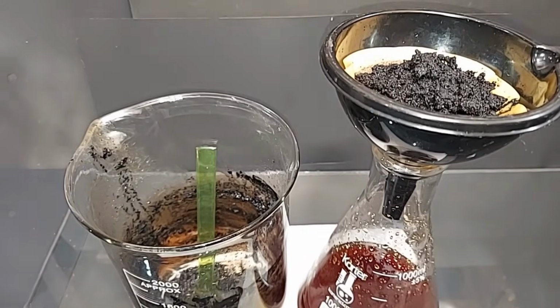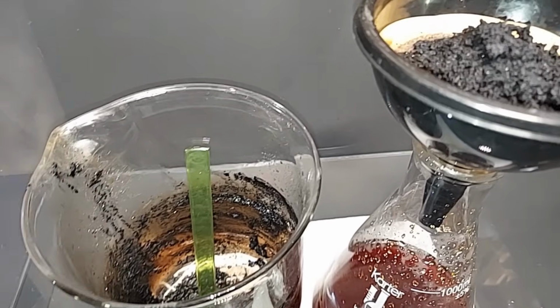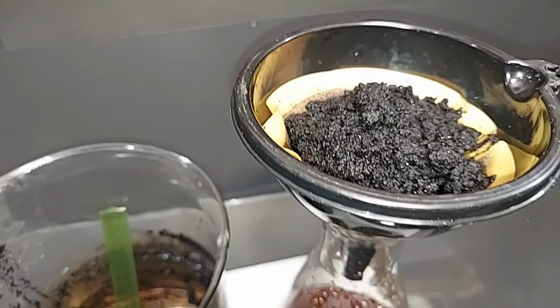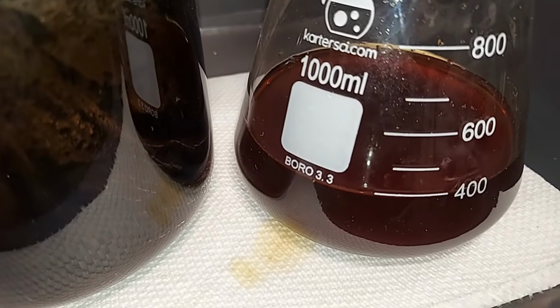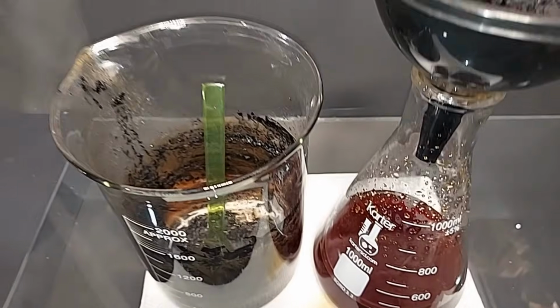When I started working with this, it turned out to be very messy. So I nixed the vacuum filtration and just did gravity filtration. Took a little longer, of course, but I basically scooped everything out of there in here. And down here is what we have to actually distill, and because there are no solids in it, it dropped down to 400 milliliters, which means I can distill this all at one time.